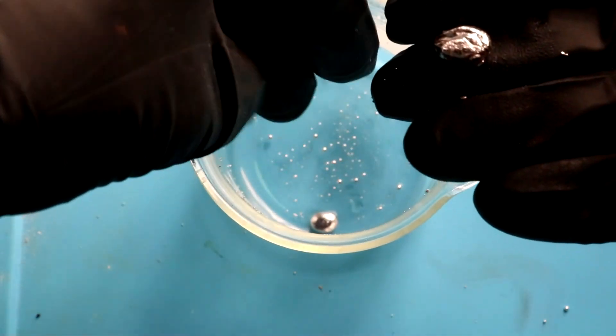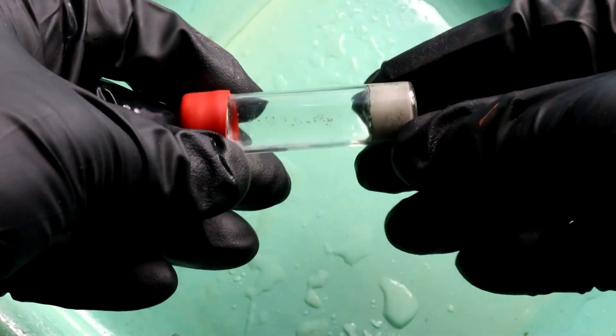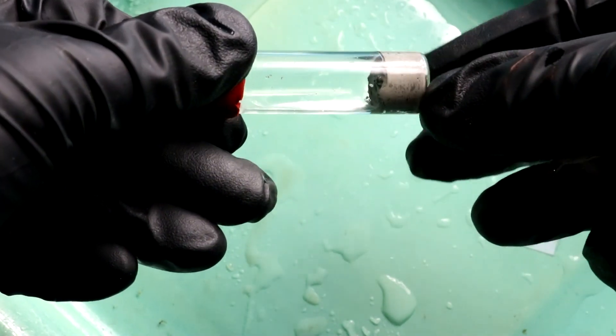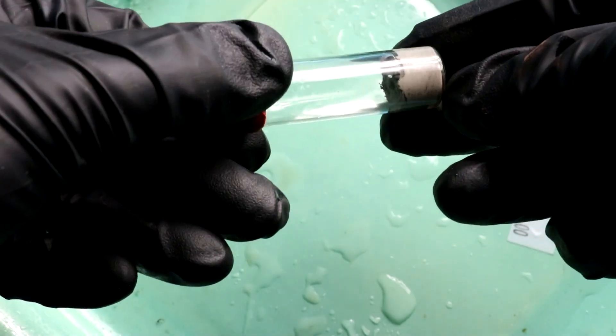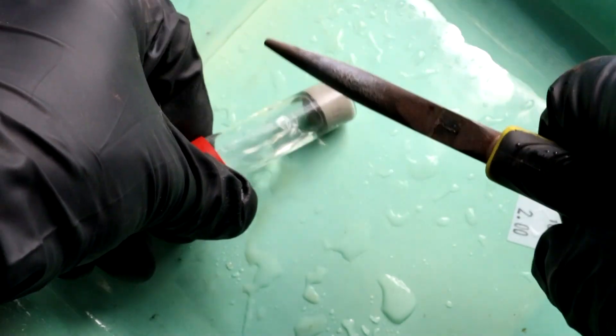In fact I have some that I mixed up yesterday. Let me go get it and show you. And here it is. You can see I actually put it inside of a bottle. And it kind of just dropped down into the bottom there. But now I can't get it back out. So I'm going to have to break the glass.